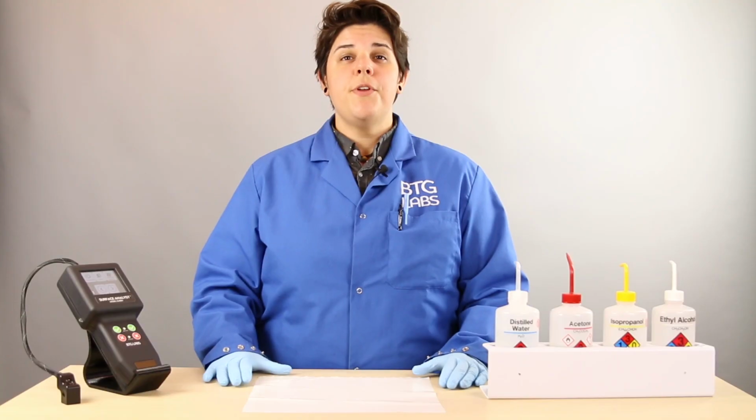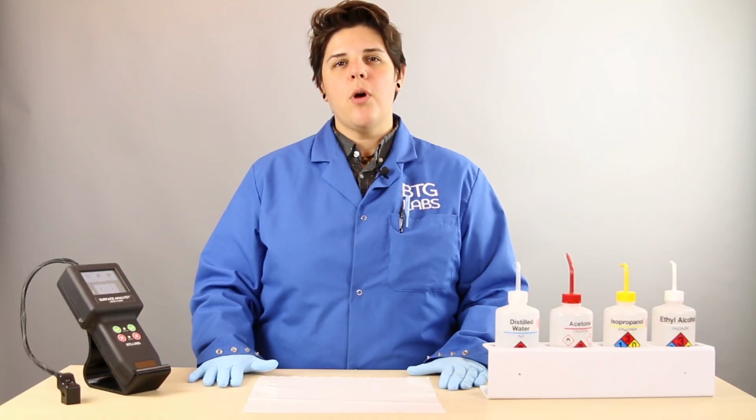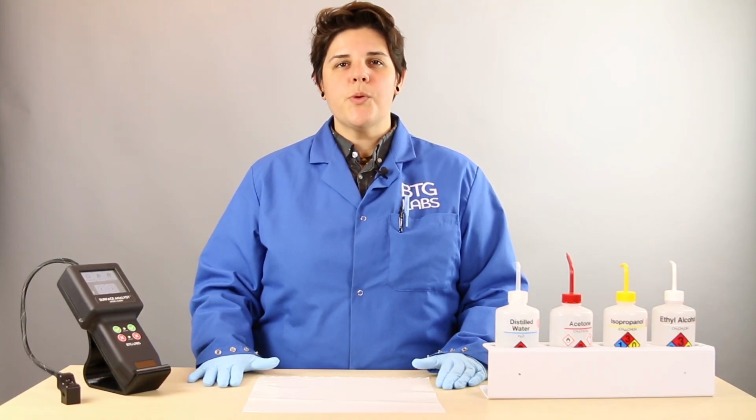In this series, we use the Surface Analyst to demonstrate how the surface of your material changes based on your surface preparation process. This video will demonstrate the changes in polypropylene film, a material commonly used in packaging for lawn treatment products, pet food, and other household goods.